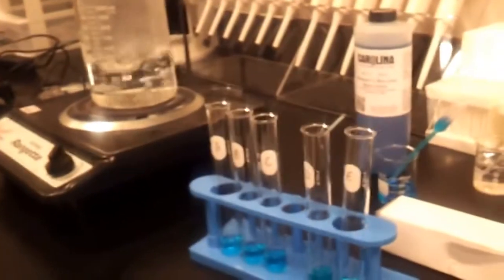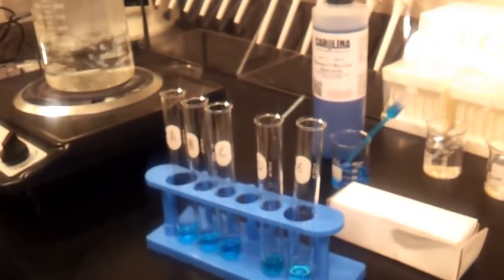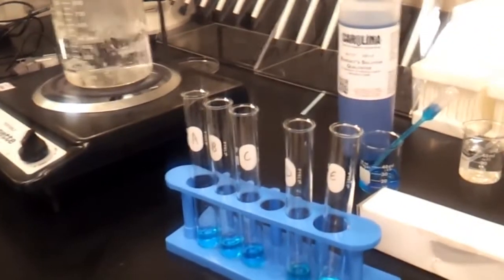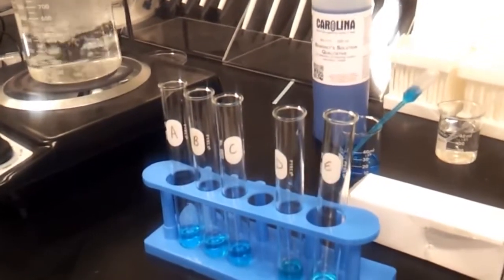Remember, a positive test shows that we should have a color change, and it'll be a noticeable color change because it'll go to red, to green, or yellow.